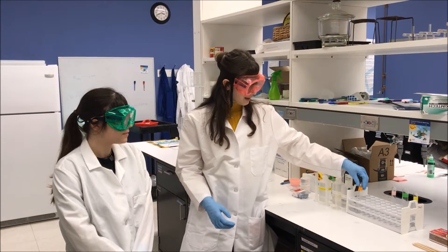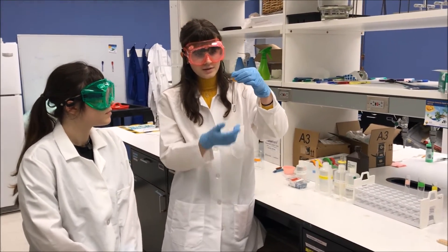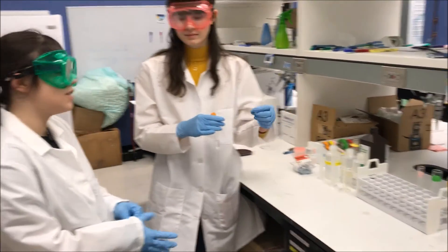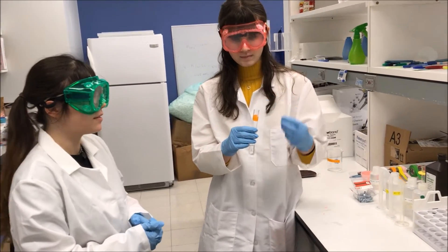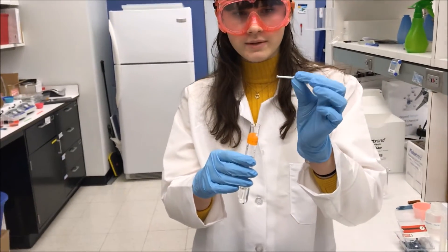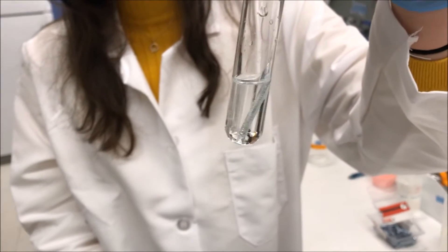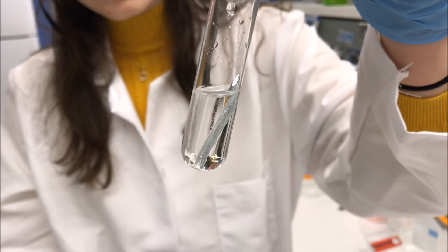We are doing reaction type A and we're doing the second procedure. We've already poured five milliliters of hydrochloric acid into a test tube, and we are ready to put in our zinc-coated nail. The procedure recommends sanding it with steel wool, but we found that it works just as well without. When you drop the nail into the test tube, you want to drop it flat side first because that will prevent the glass from breaking. As you can see, bubbles are forming — that is hydrogen gas — and this is an example of a single displacement reaction.